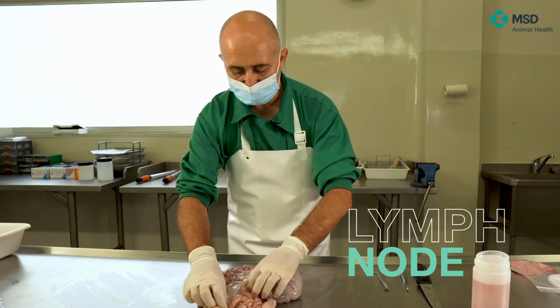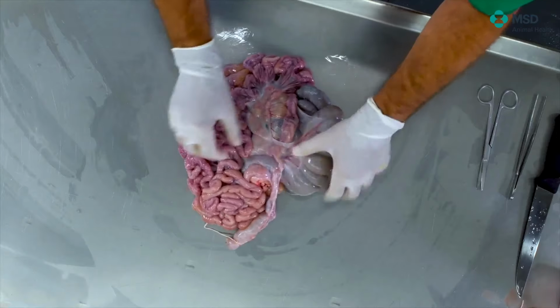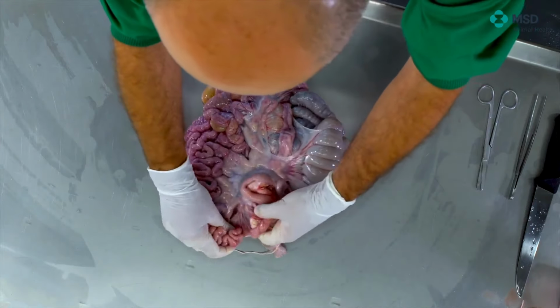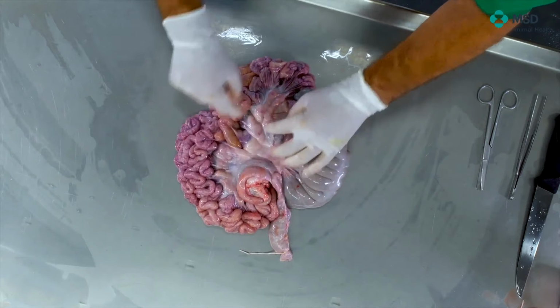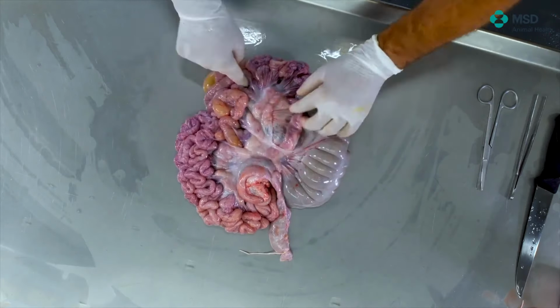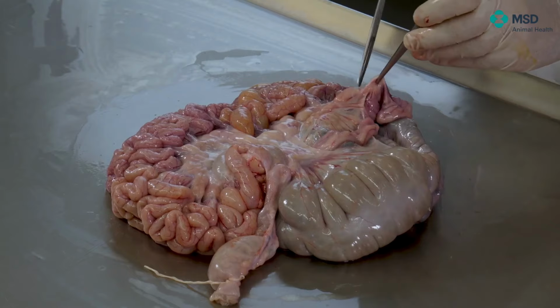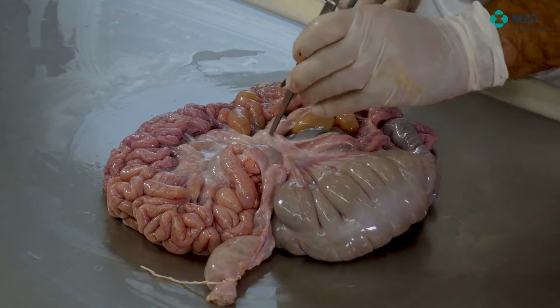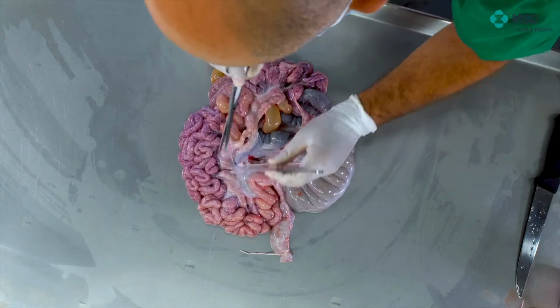So what I will do here is expose the lymph node maximally, and you will see how big it is. Look, it's all that part in there. So we will try to remove as much as possible. This, of course, may take some time, but it's not a lot of time, really. So, as you can see here, we will try to be fast. Even sometimes when you are faster, you are just cutting one of the loops. We will try not to do so.